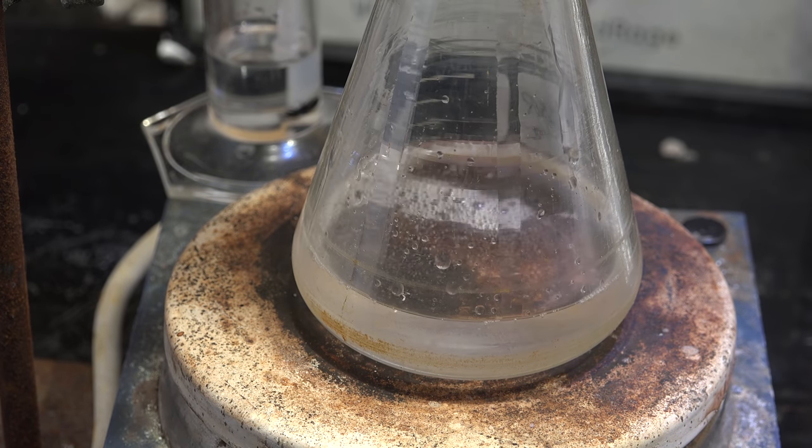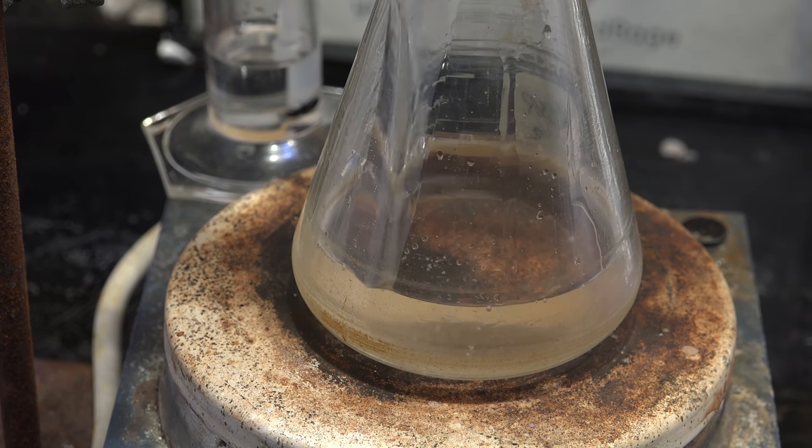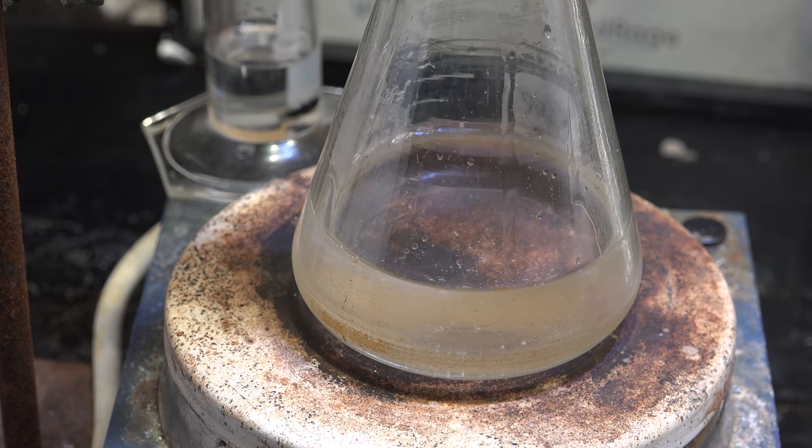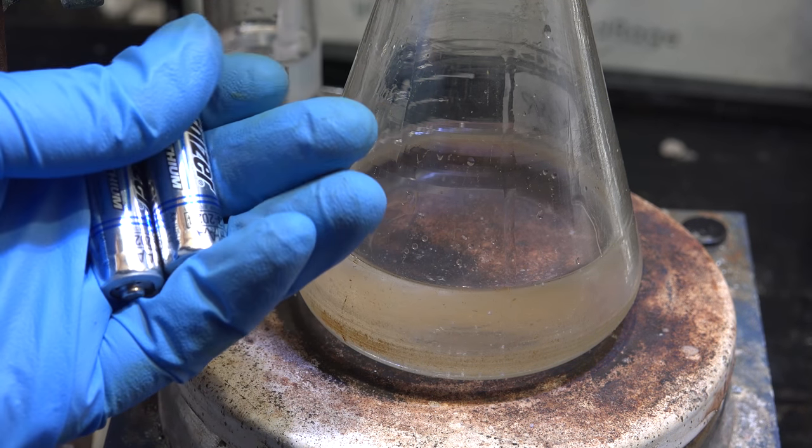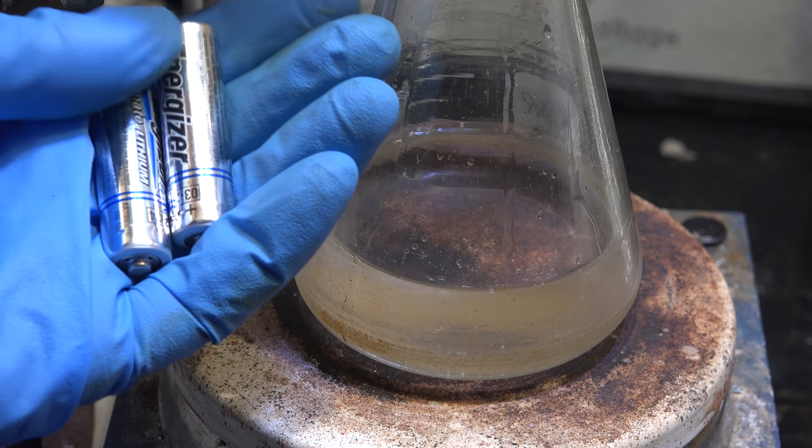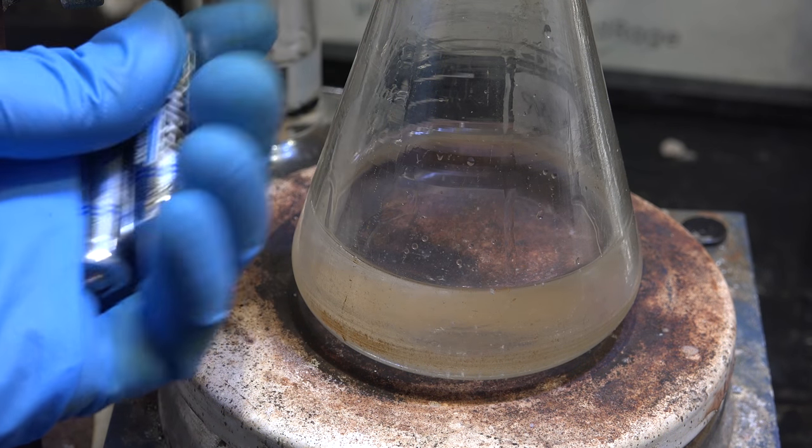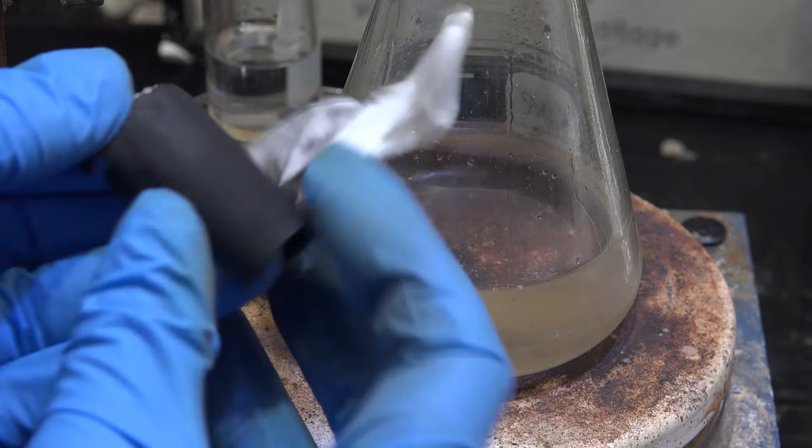First I'll fill it with oil. At this point I'm going to move on and try a new drying agent, lithium metal. Lithium metal is actually not that hard to get. It can be obtained from energizer lithium batteries. While this is extremely expensive and that's why I never considered it for making sodium earlier, it only needs to be used once to dry the sodium hydroxide and jumpstart the reaction.